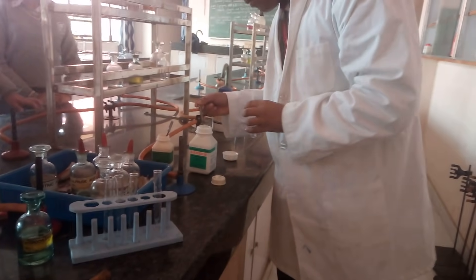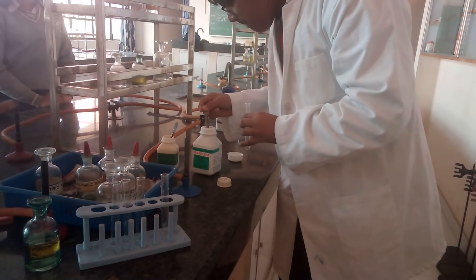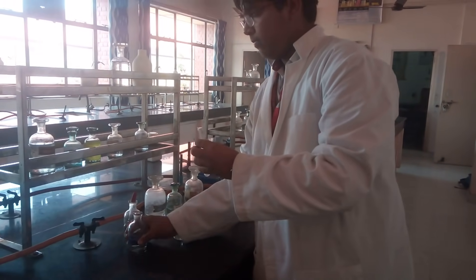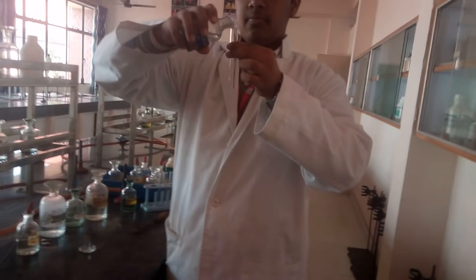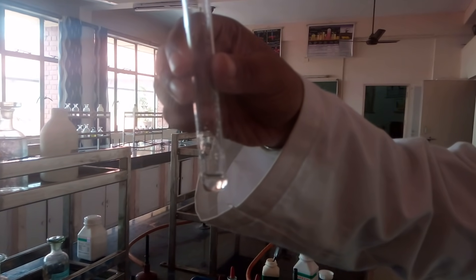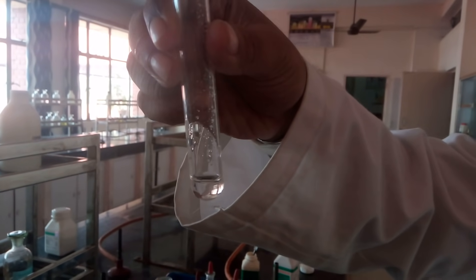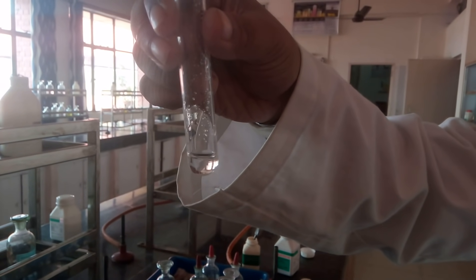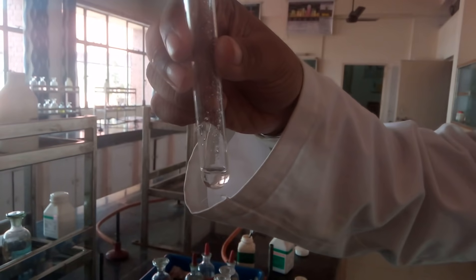We begin. The first step is you will take a pinch of salt in the test tube and add dilute sulphuric acid. Have a close look at the test tube — there is no gas evolved, no bubbles, not even a single bubble, which means that the first set of anions are absent: carbonate, sulphide, and nitrite.